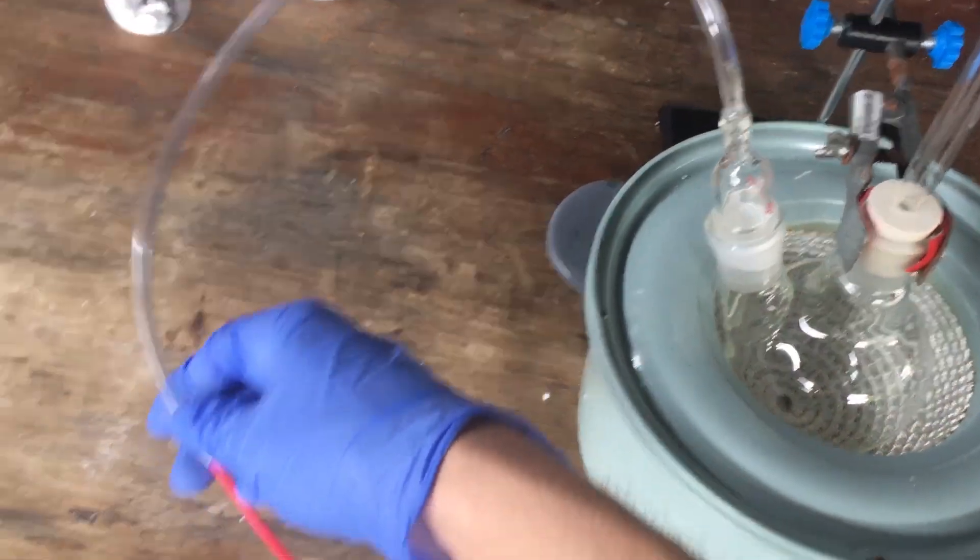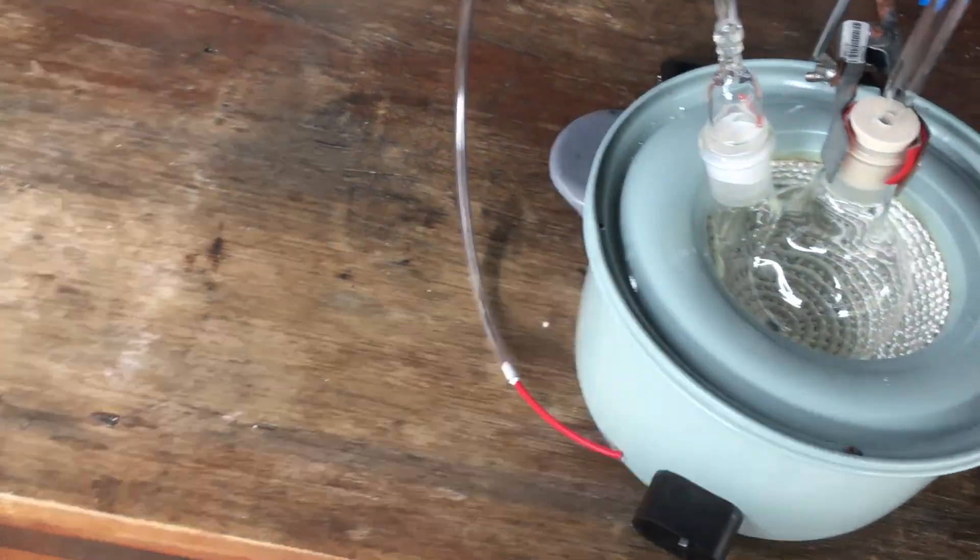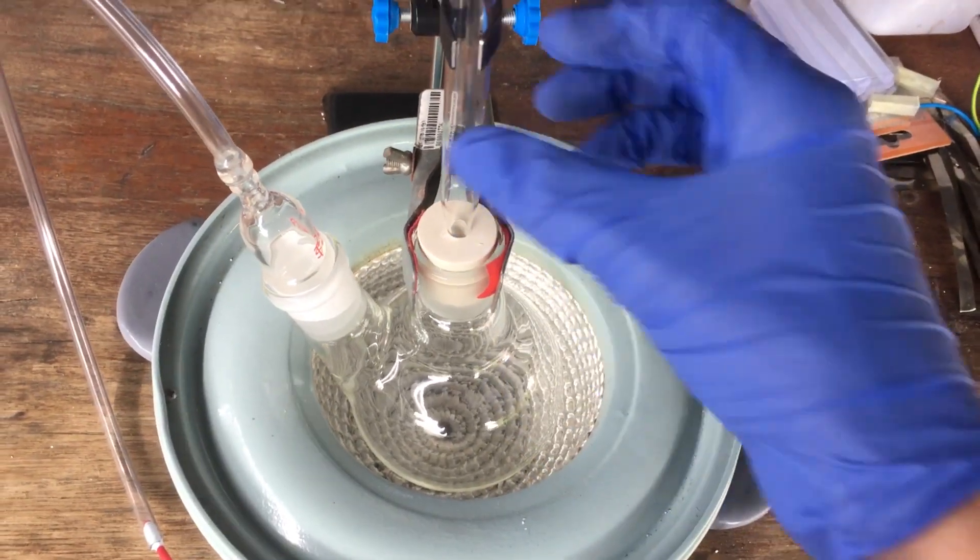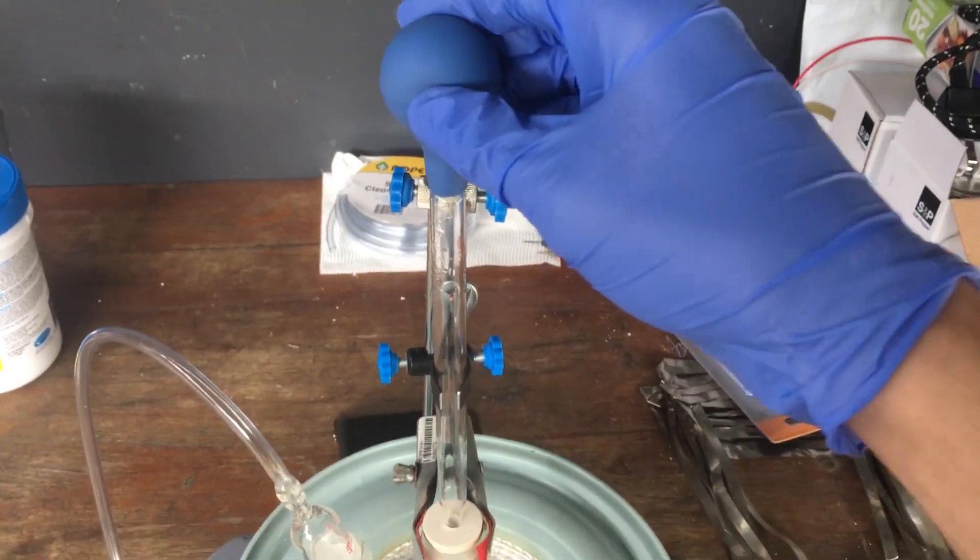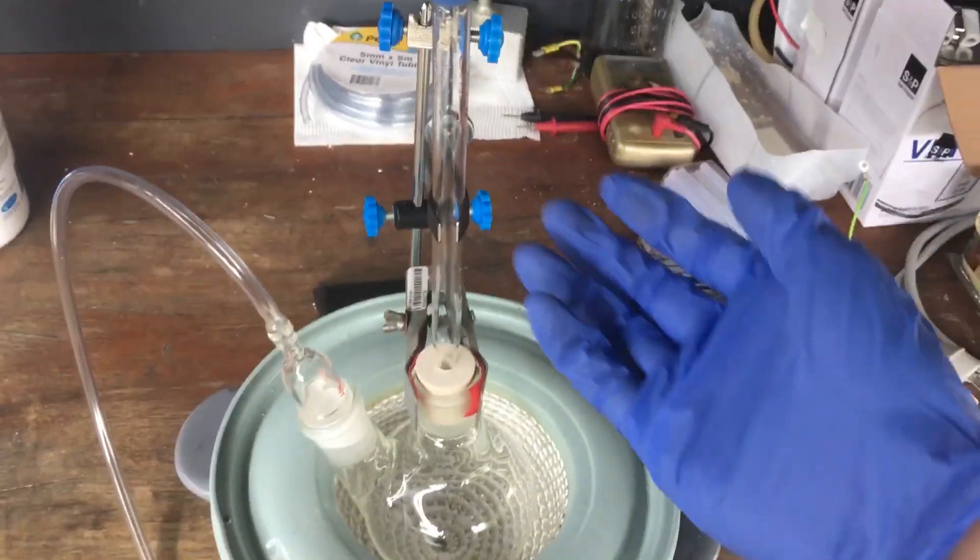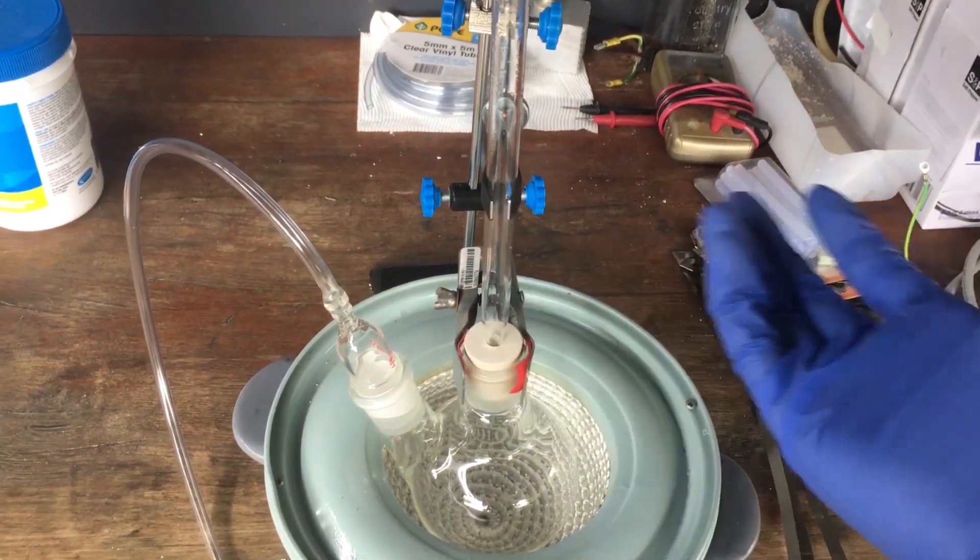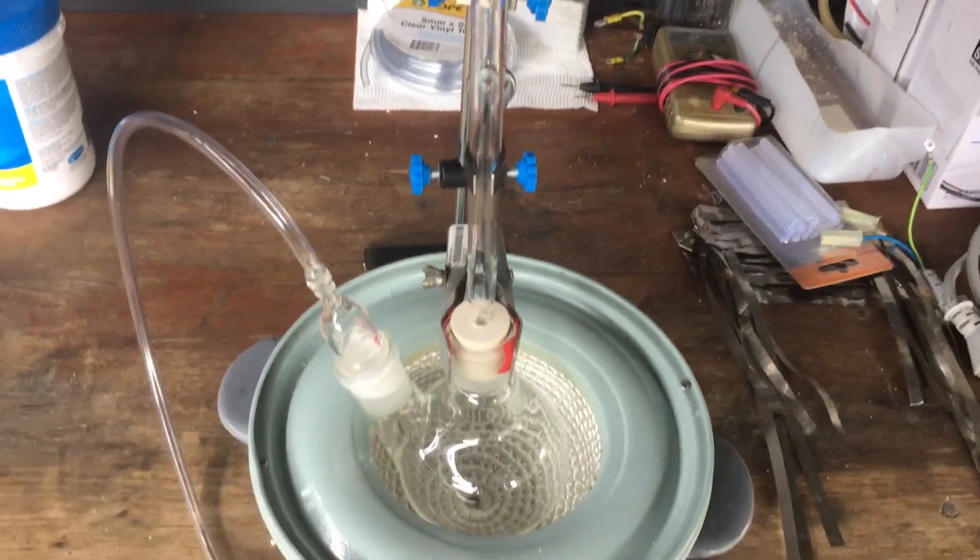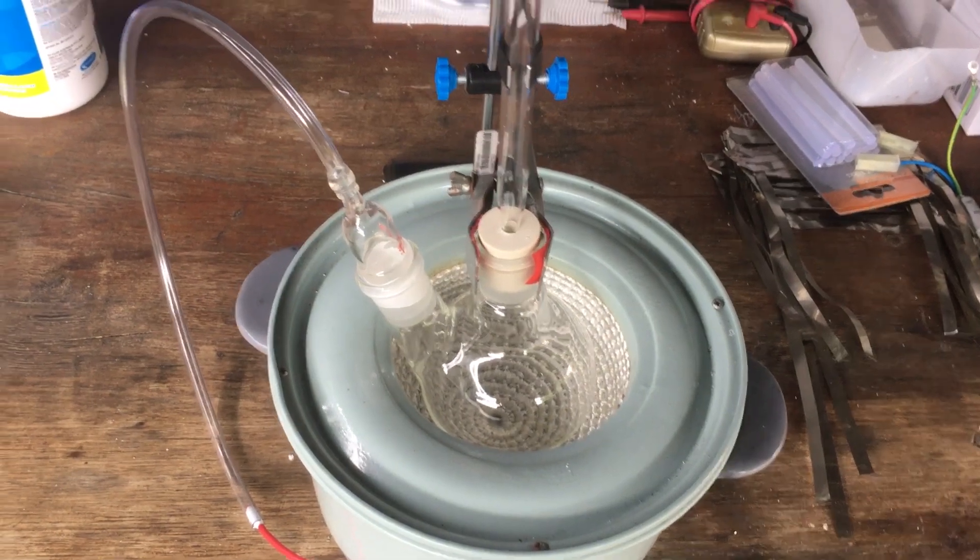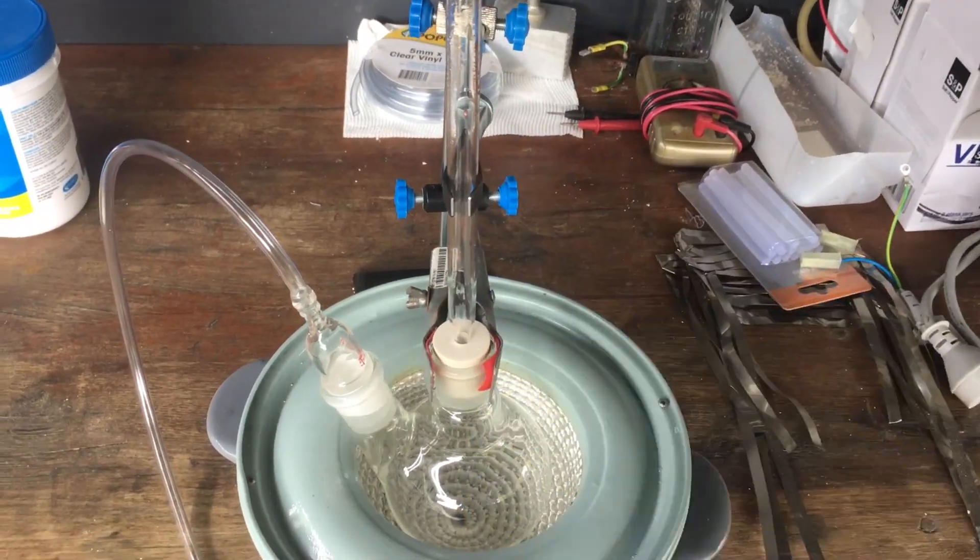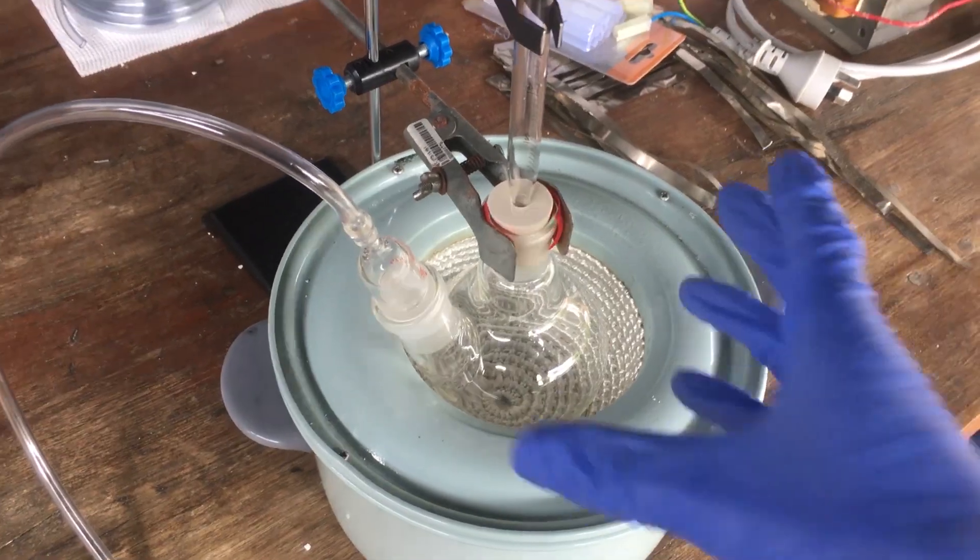We have our gas takeoff, which will go through a line here, which we will fill our ampules with the gas. I have a little stopper here with a hole in it, and I just have a pipette that we will fill with around 10 milliliters of hydrochloric acid. I'm hoping that will just work fine as it is, seeing as we're dealing with a small enough quantity of hydrochloric acid to just use a pipette like this. So it couldn't really be simpler than that.